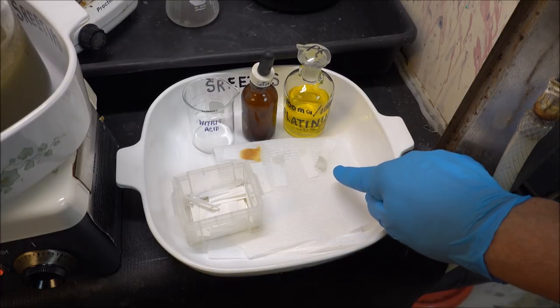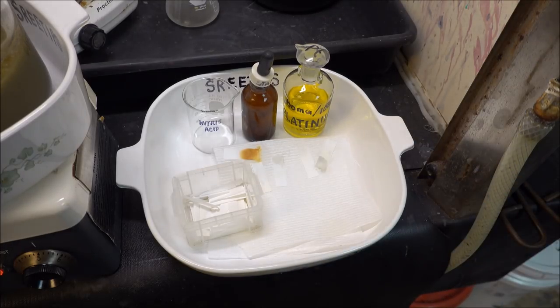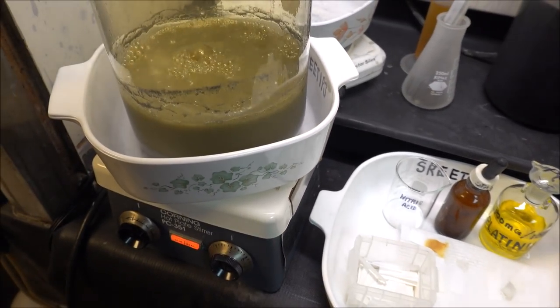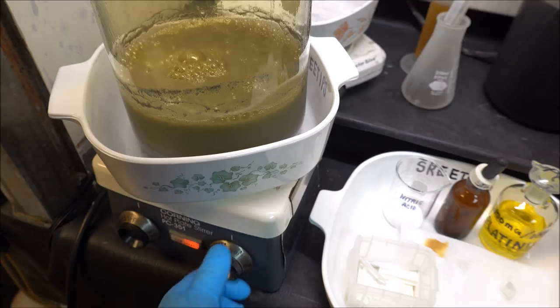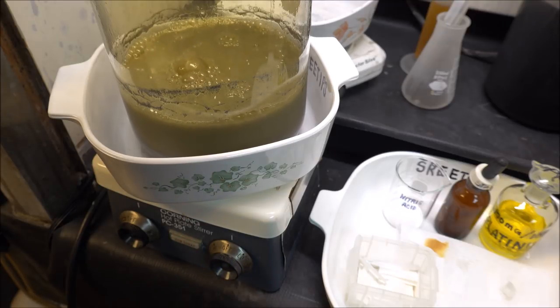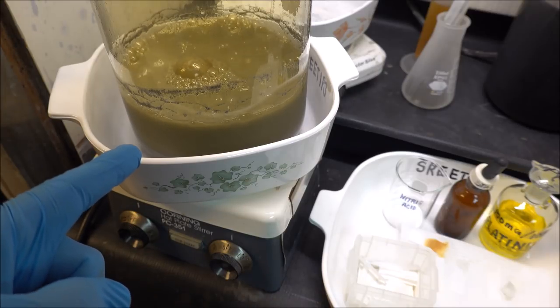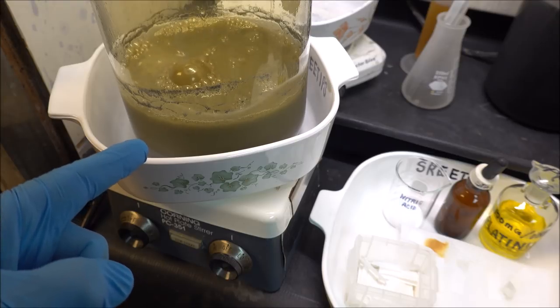Based on these test results, I'm going to conclude the experiment right here and turn everything off. I'm not going to waste any more reagents or any more time trying to extract any platinum from this hard disk drive material. So this will conclude the hard disk drive platter refining experiment. As you can see from my results out there, there's very little platinum to get out of those things. I give this my very best effort. It took three days of work and a lot of reagents and I got nearly zero platinum from those hard disk platters.